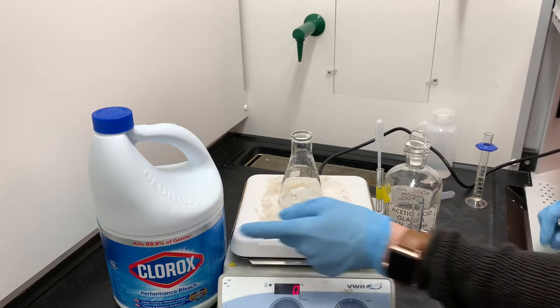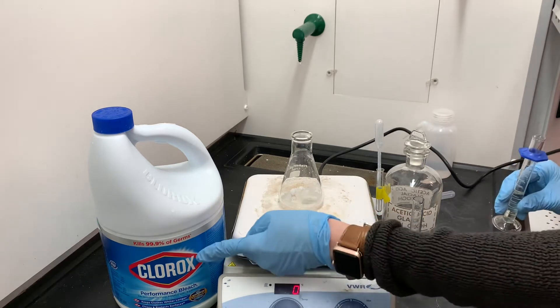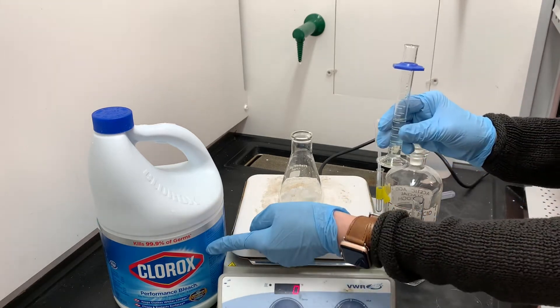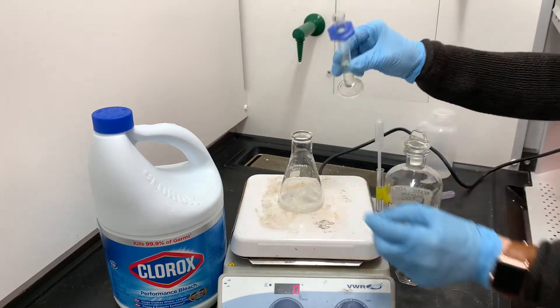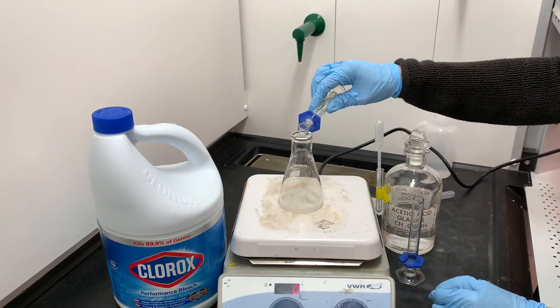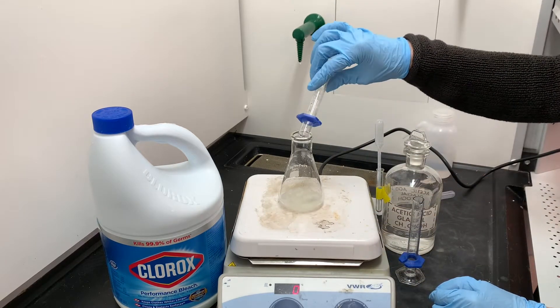Next we'll be adding the bleach. I have measured out about five milliliters of the bleach. The label on the bottle doesn't tell me exactly what the concentration of the bleach is, so I'm just kind of guessing five milliliters is an appropriate amount.